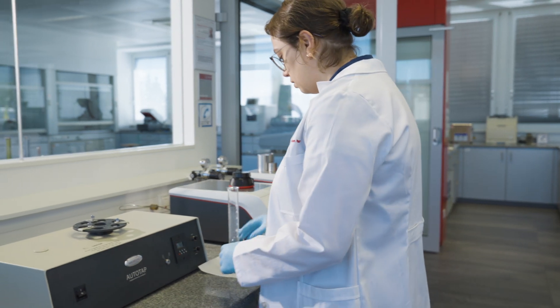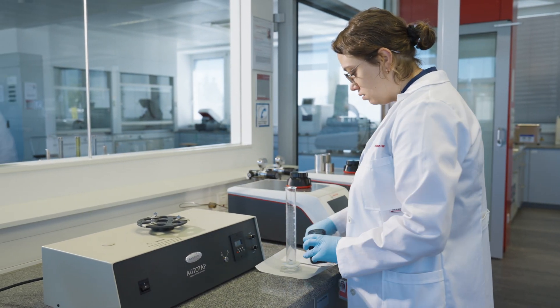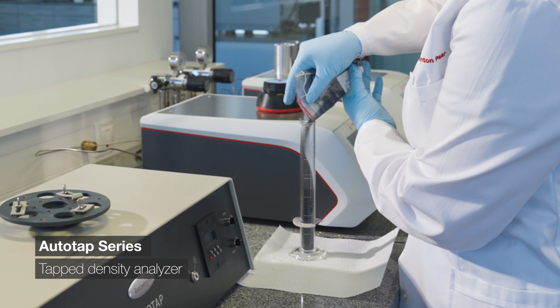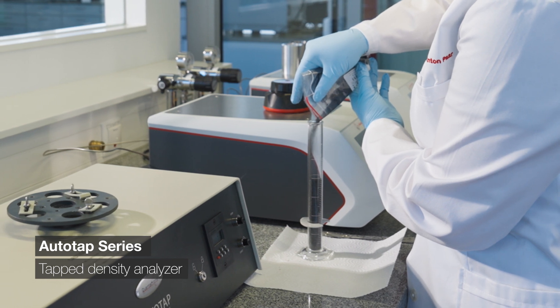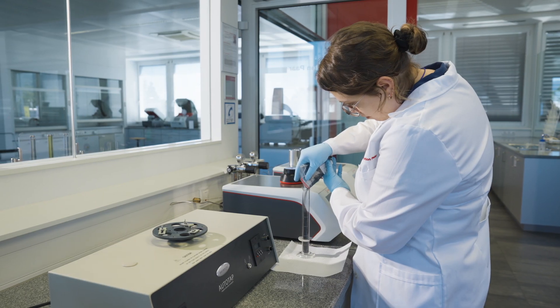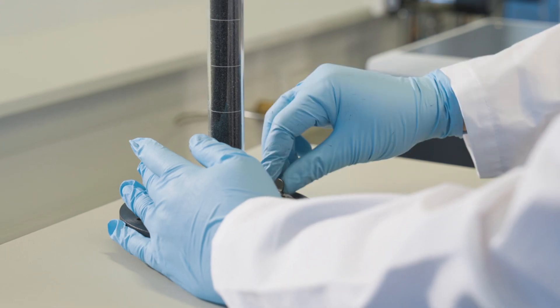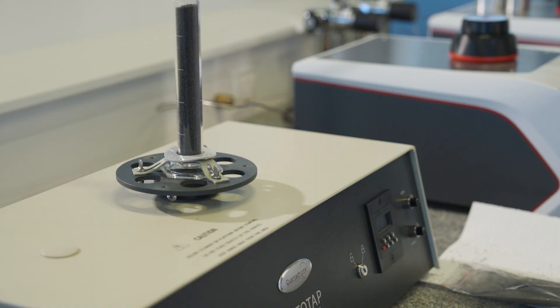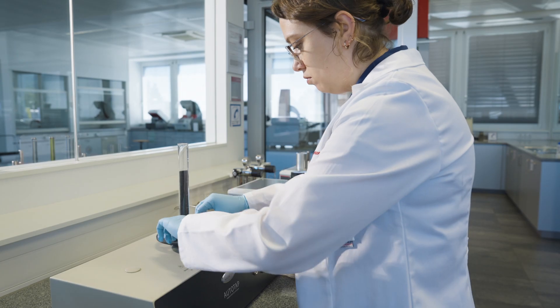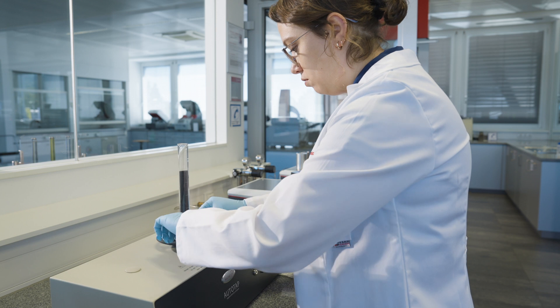The principle of measuring tap density is very simple. Weigh a certain amount of powder material in a graduated cylinder or sample cell, and once in a packed state — which means after multiple taps — simply record the volume and determine the tap density value.